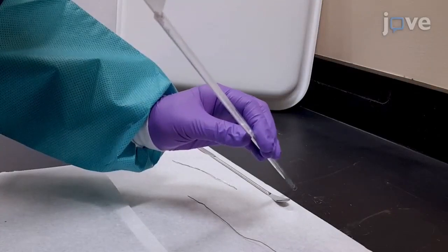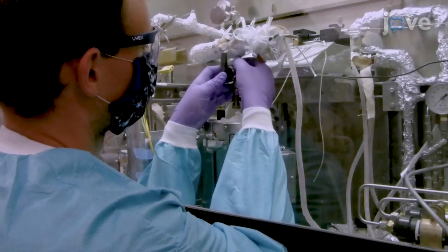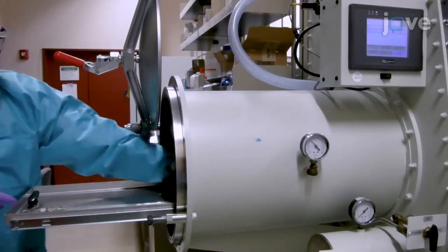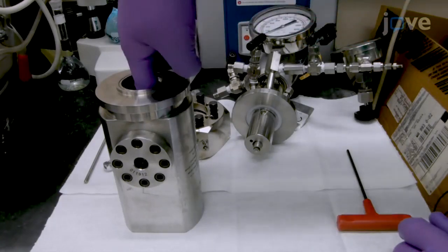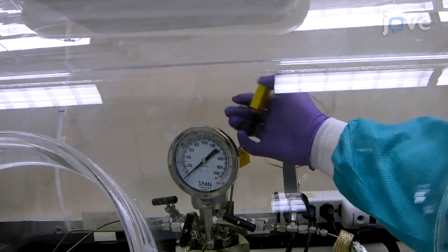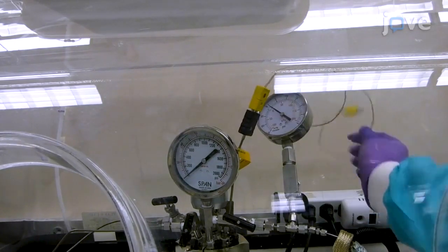This non-destructive method can be used to analyze complex systems at controlled temperatures and pressures over time, and is therefore highly useful for investigating key scientific questions. These methods allow NMR experiments to be conducted under tightly controlled and specialized conditions to solve problems under environments relevant to the scientific hypothesis being explored.